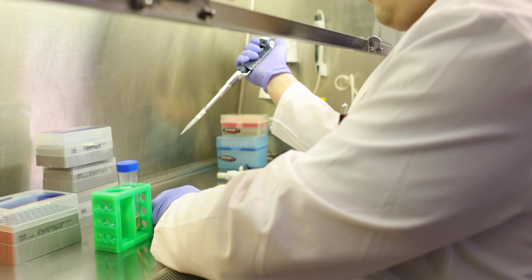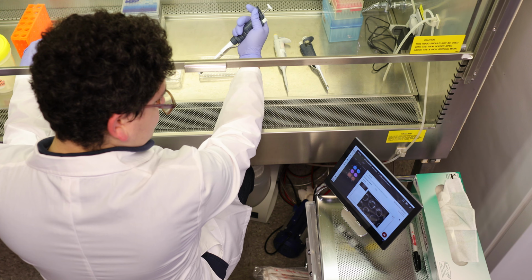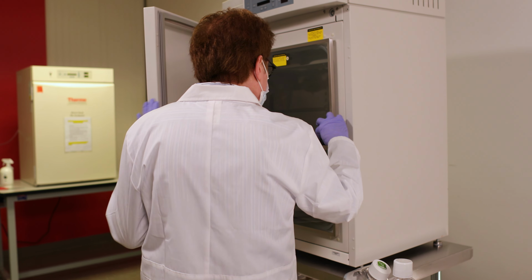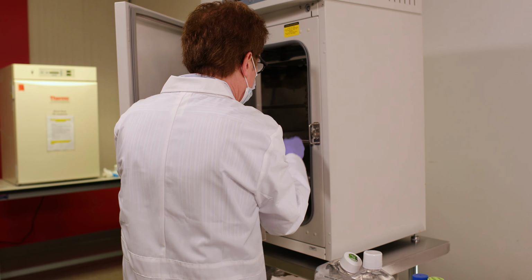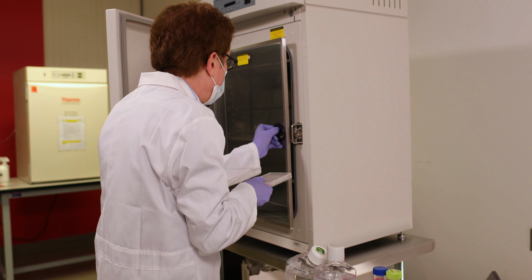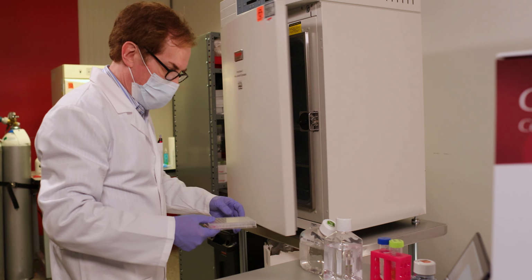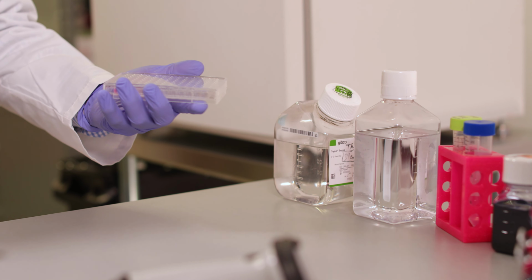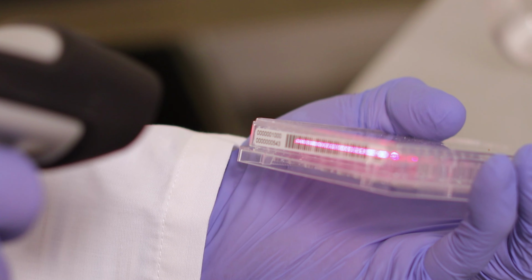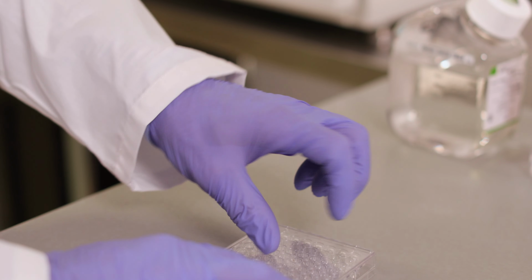Later, when you're making your plates, CellAssist is your guide every step of the way. A barcode label is attached to your plate. CellAssist uses these barcodes to track the plates automatically within the system. No more sticky notes that become detached. No more writing on plates with markers or fumbling through menus. Each time you insert a plate into CellAssist, that plate's screen is called up for you automatically, ensuring accuracy and reproducibility. With CellAssist, you'll always be on the right screen.